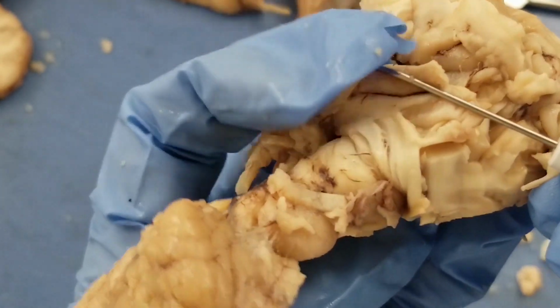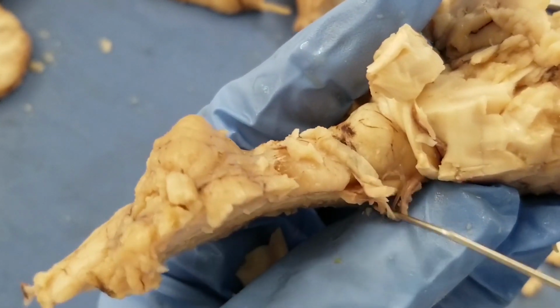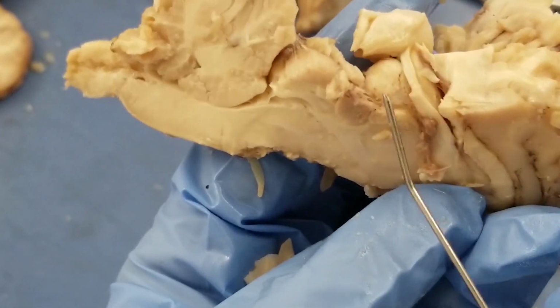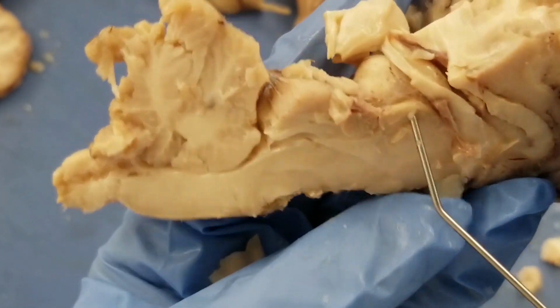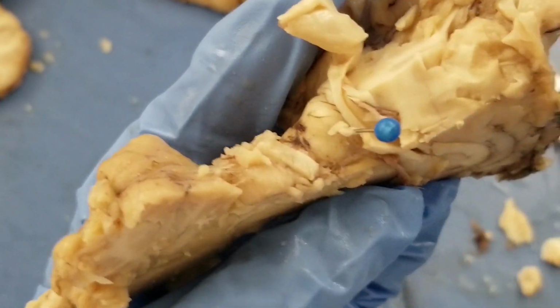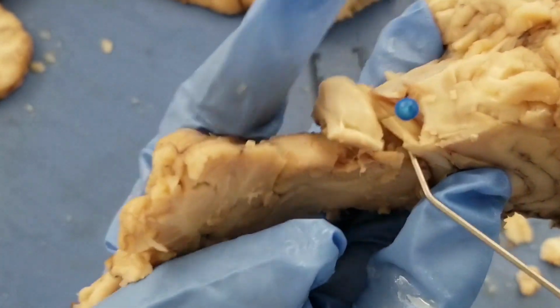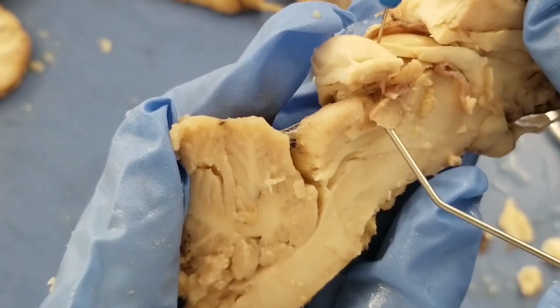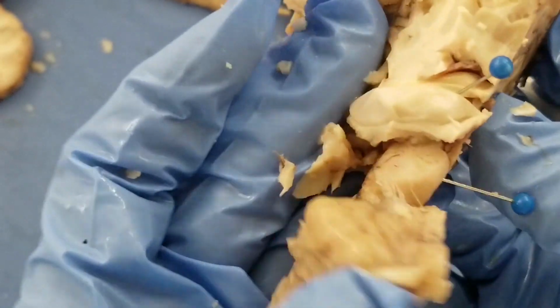If you flip that over, you see this round structure here. That's actually the thalamus. And what is the function of the thalamus? That is the post office, is that right? That's the relay center. So from the mid-sagittal view, you see the thalamus is like this. It goes around and it's a bumpy structure. Pin that. Thalamus. And then you can see there's a structure here. This is superior colliculus. That's the eye movement center, right? And this is the pineal gland. So superior colliculus.